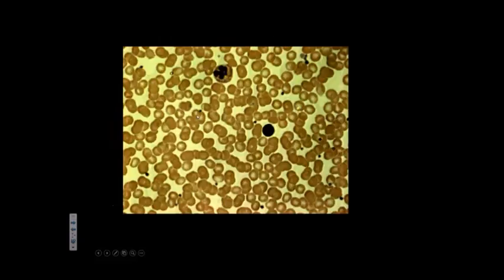So now look at the size again. Because this is lower magnification, this is a monocyte, and that could be a basophil. And this could be a neutrophil. This one is really, really dark. There's some red in there. As a result, I lean towards either eosinophil or basophil. Yeah, this one's pretty big in comparison.